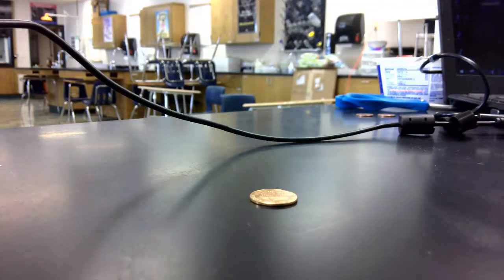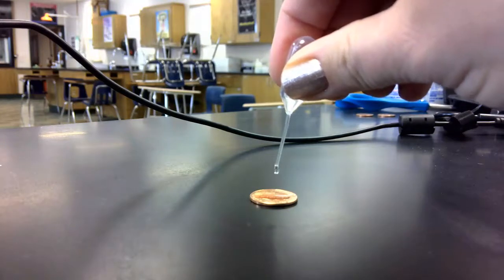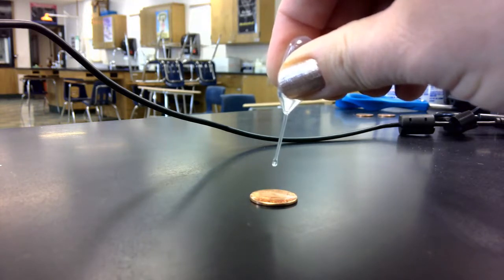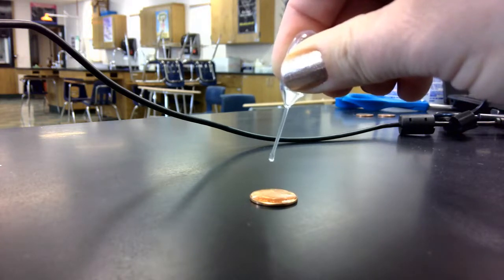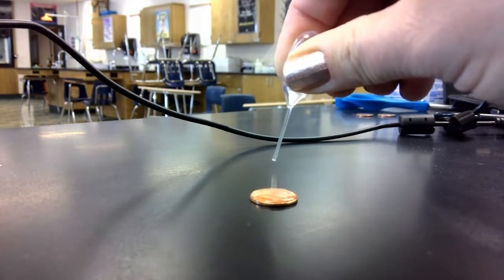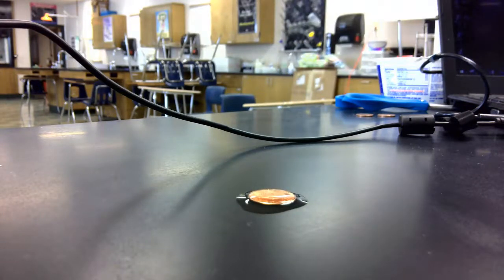I'm going to be completing the same process this time but using acetone instead. Acetone has a pretty distinct smell — it smells like nail polish remover. I'm going to be dropping it, and you guys get counting. All right, so that is acetone.